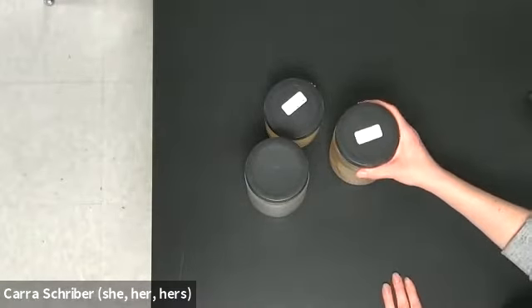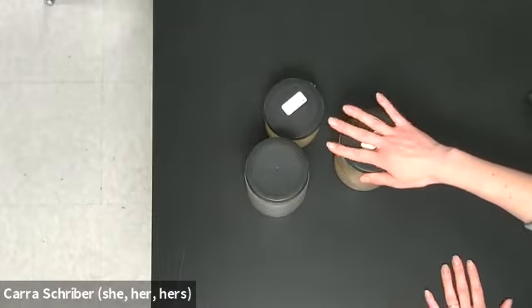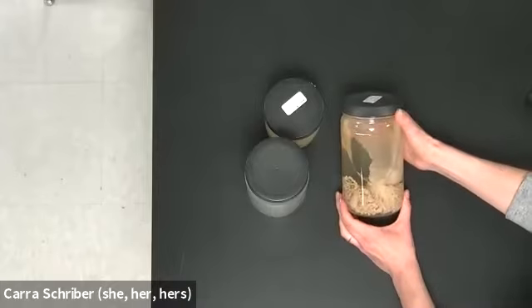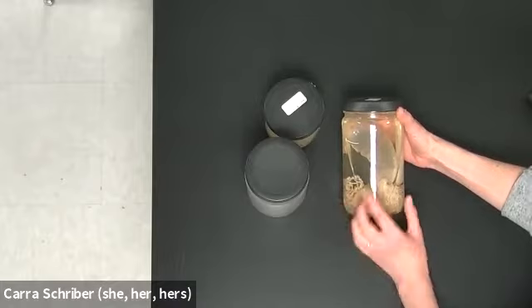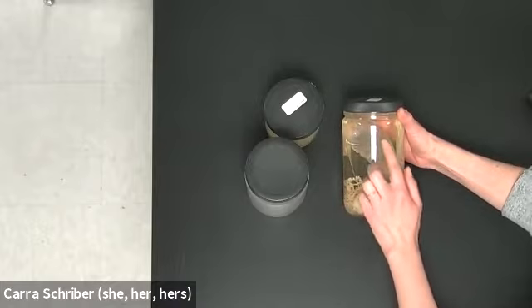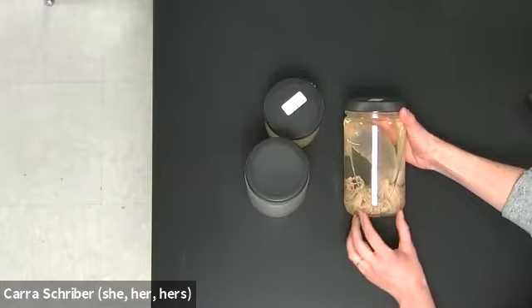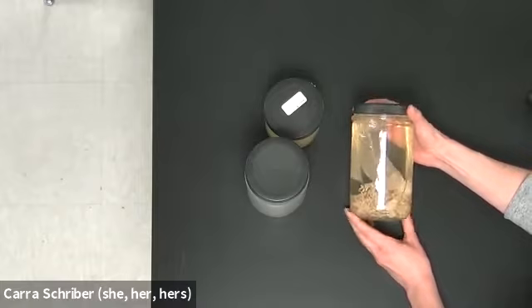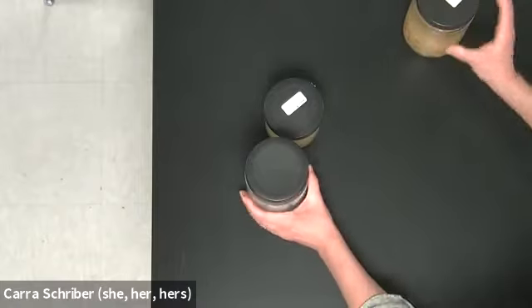These specimen jars are like from the 70s. So I'm not going to probably open this because it would be foul, but I'm going to tip it over for you, and hopefully you can see. So this is a man of war jelly, and you can see on the top is kind of this balloon type thing. And then on the bottom here, you can see that there's lots of little things hanging down from it. And those are actually going to be the tentacles. All right, so that's one specimen we have.